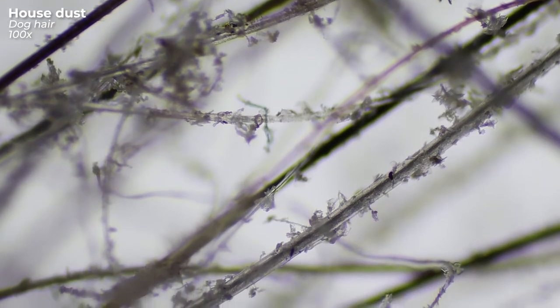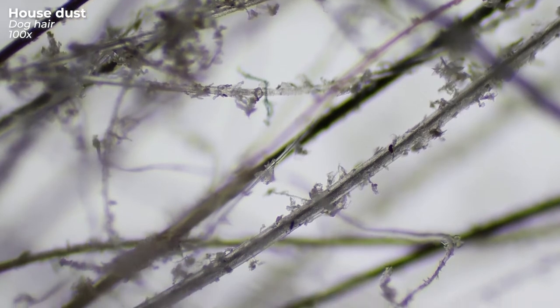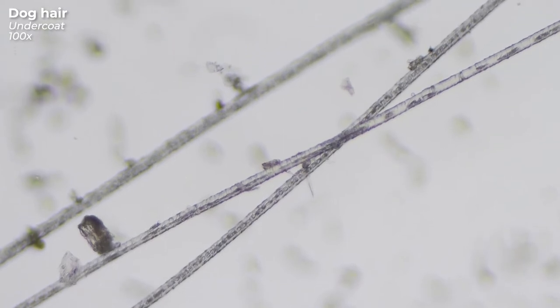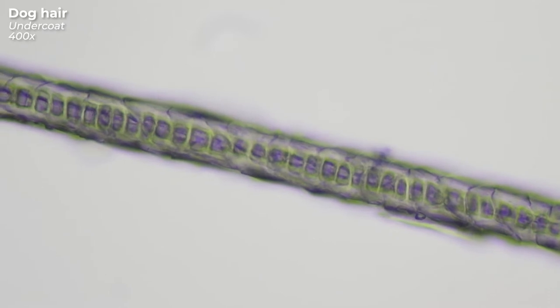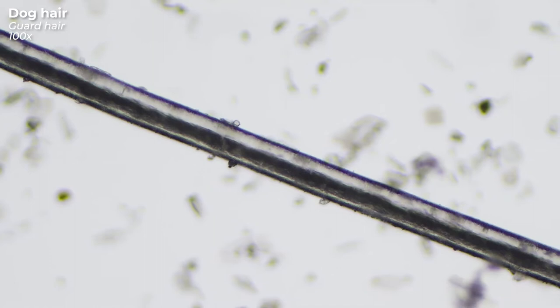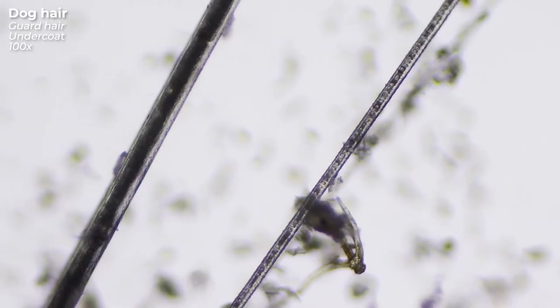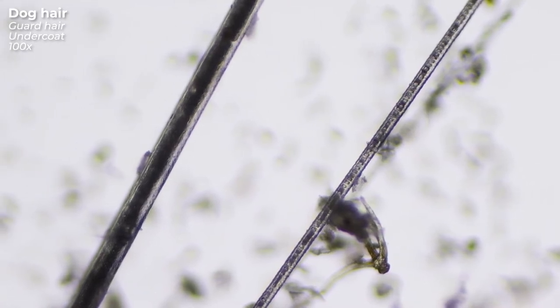A closer look at the individual hairs reveals some differences. Here you can see a hair from his undercoat — it looks very thin and is almost transparent. This is a guard hair from him. Compared to the hair of his undercoat, it is much thicker and stronger in its structure.